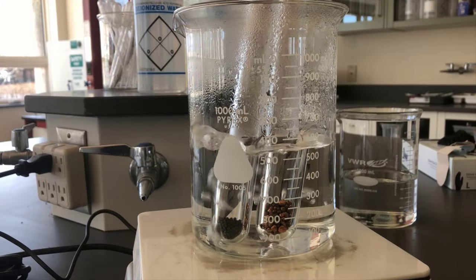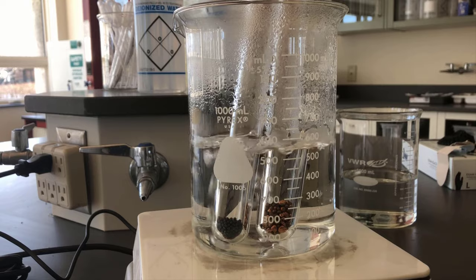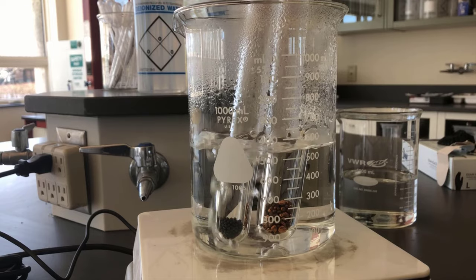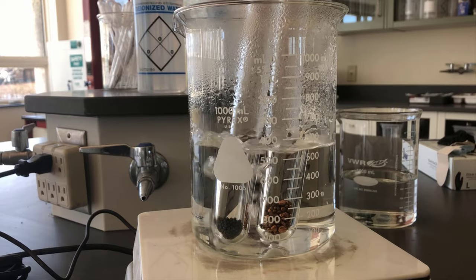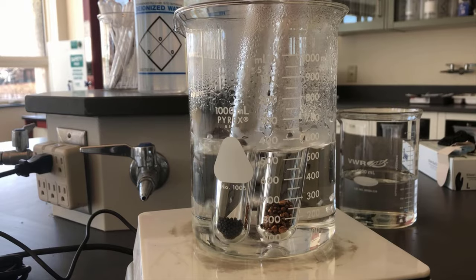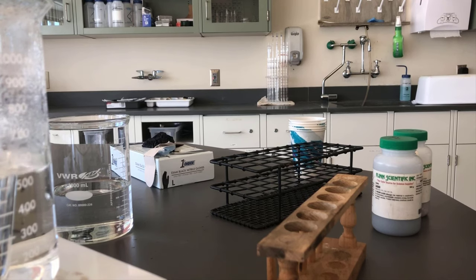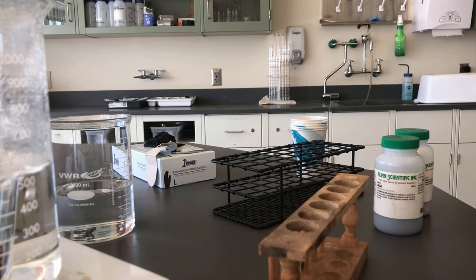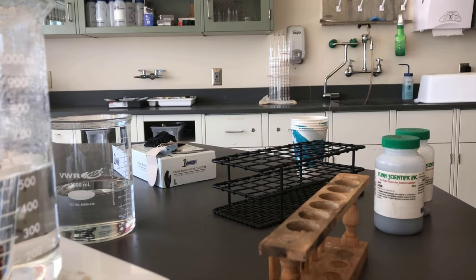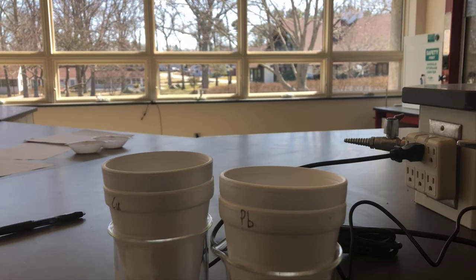Here is our first step: we're simply heating our two metals. Just to save time, I've already measured out the masses for these two — for lead we have 51.13 grams and for copper there is 51.41 grams. What we'll do next is just remove these using hot mitts, and we're going to put them into the test tube rack here. Moving as quickly as we can, we're going to take the temperature — of course, every moment that we wait, they'll be losing heat to the surroundings. We'll take the temperature and then very quickly get those metal samples thrown into the calorimeters.